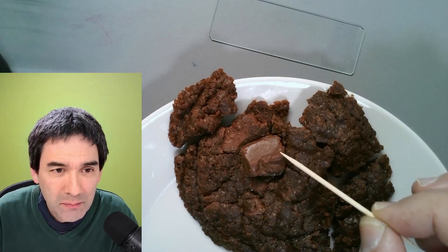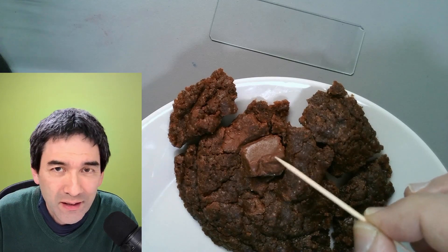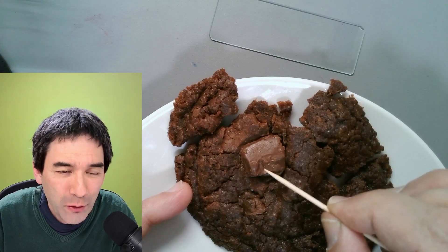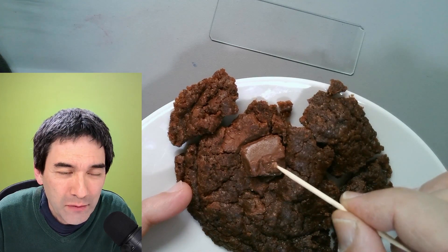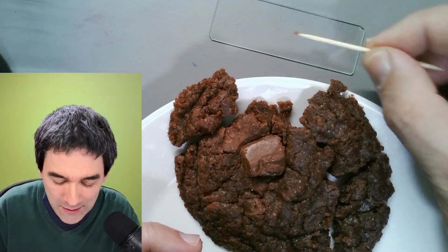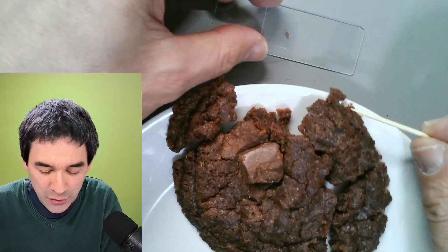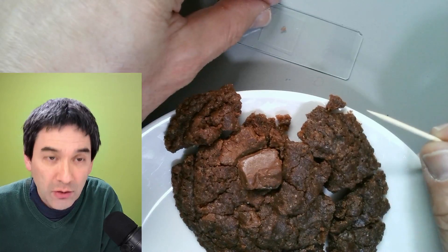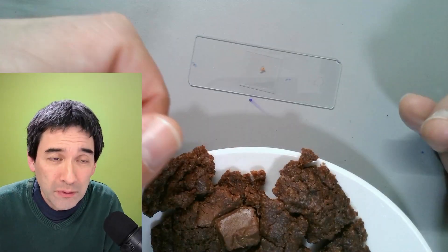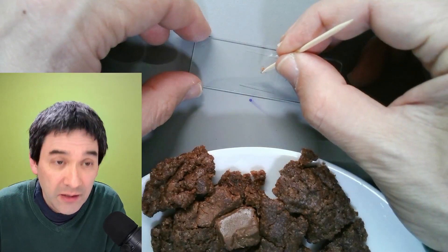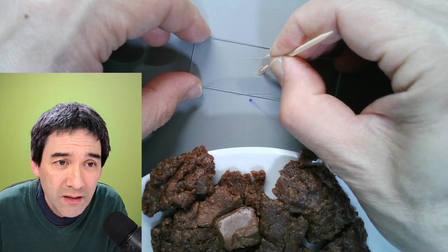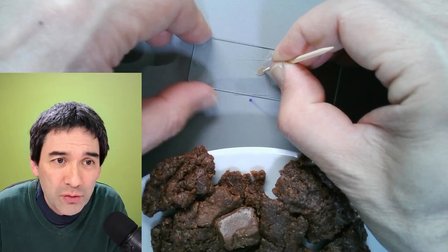Let's take a little piece of the chocolate here and try to put that under the microscope. It's not so easy because it's fairly hard. But with a little bit of patience, I was able to scratch off a tiny amount of chocolate. Let's put it on the microscope slide. Cover glass goes on top. No water this time because chocolate contains a lot of fat. Fat and water do not mix properly.